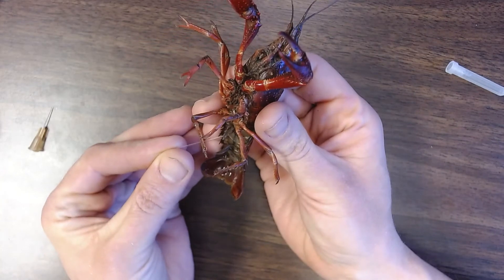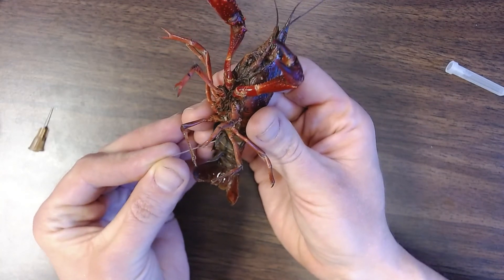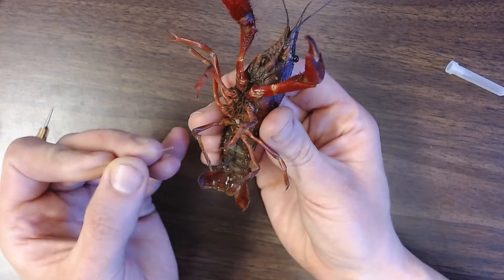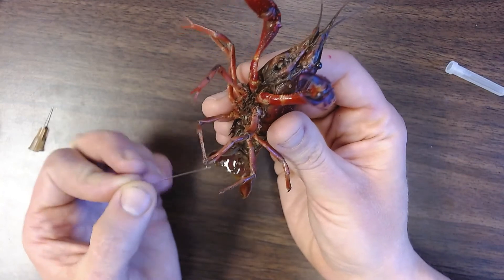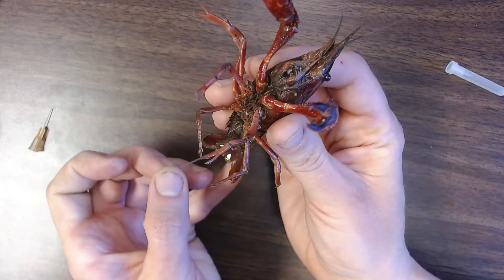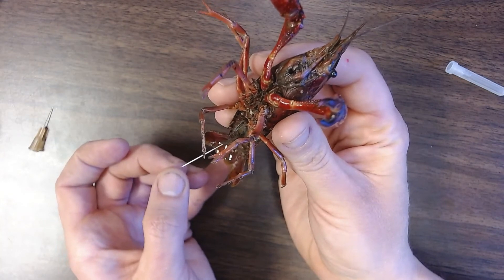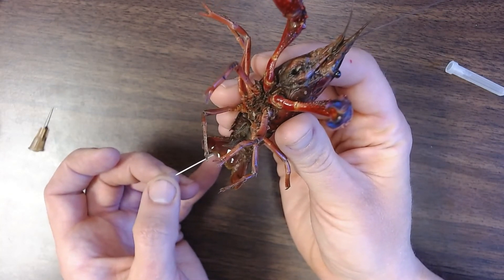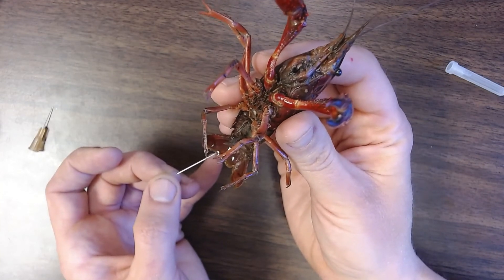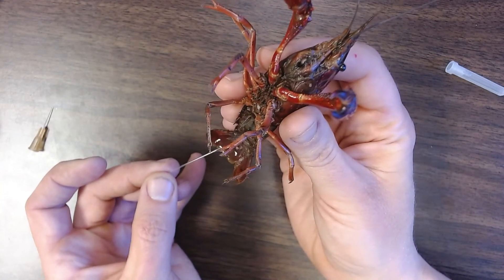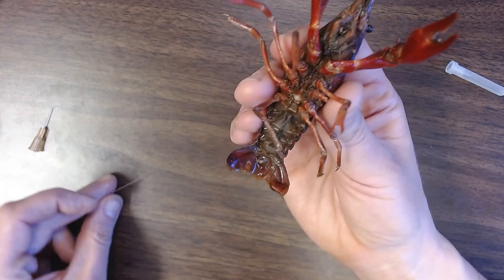And then it has soft points in its carapace on the underside here. So I'm just going to look for a soft point and I'm going to poke a little hole and then I can actually see there's hemolymph running from that hole. And I'm going to hold my capillary tube where I put that puncture. And actually the blood at this point is now pooling up in the bottom of the tail. You want to hold your capillary tube horizontal at the edge. If you look really close you'll see that filling up with hemolymph from the crayfish. All right thanks buddy!